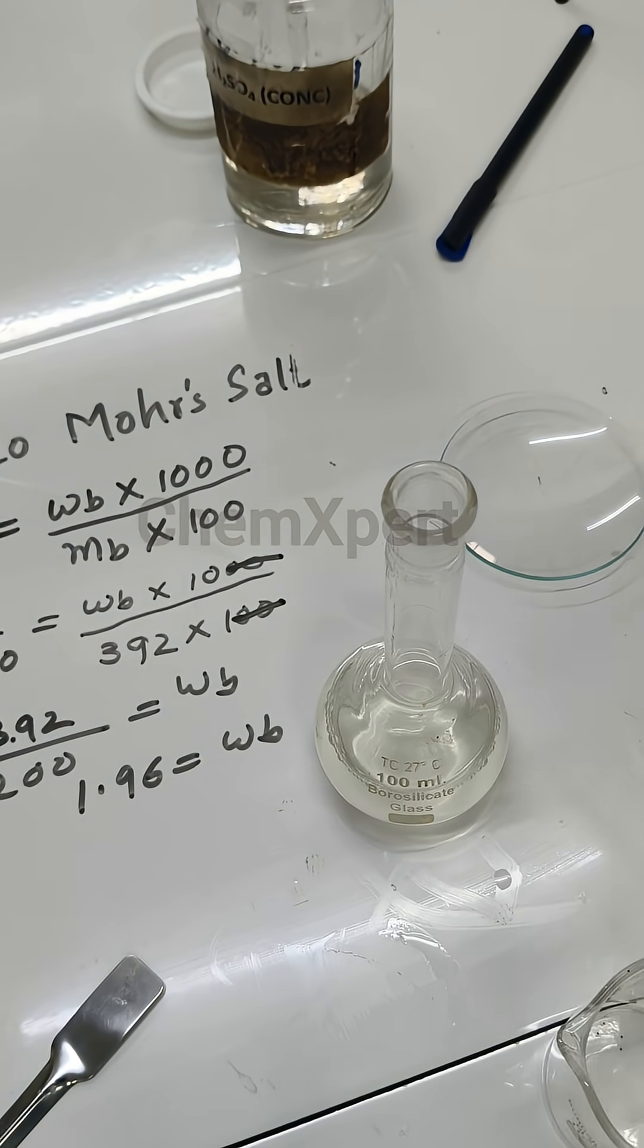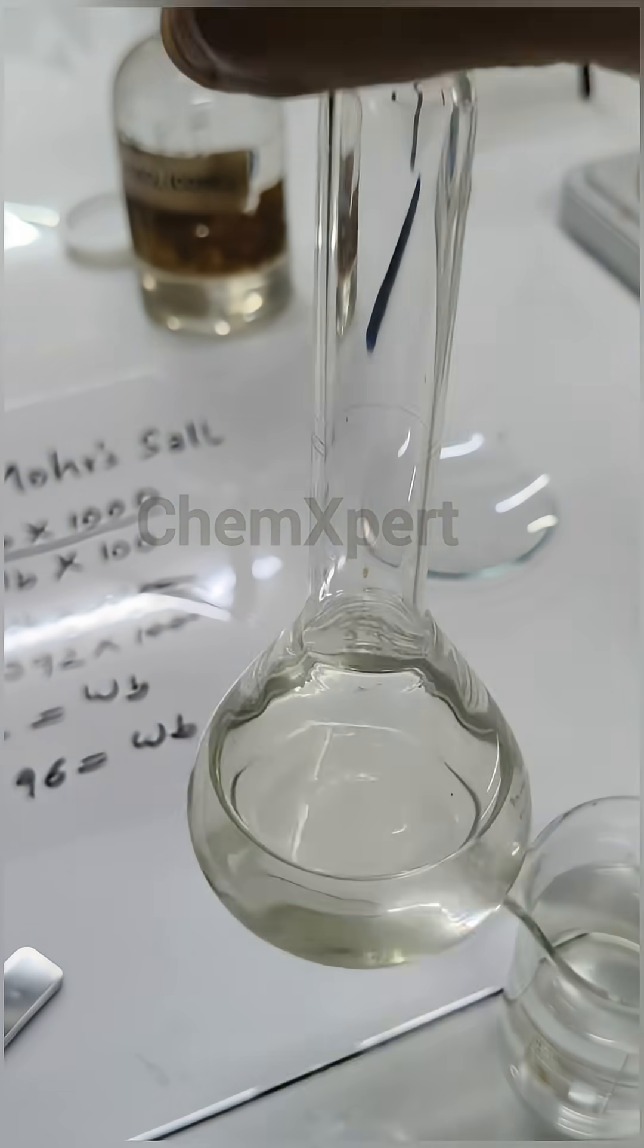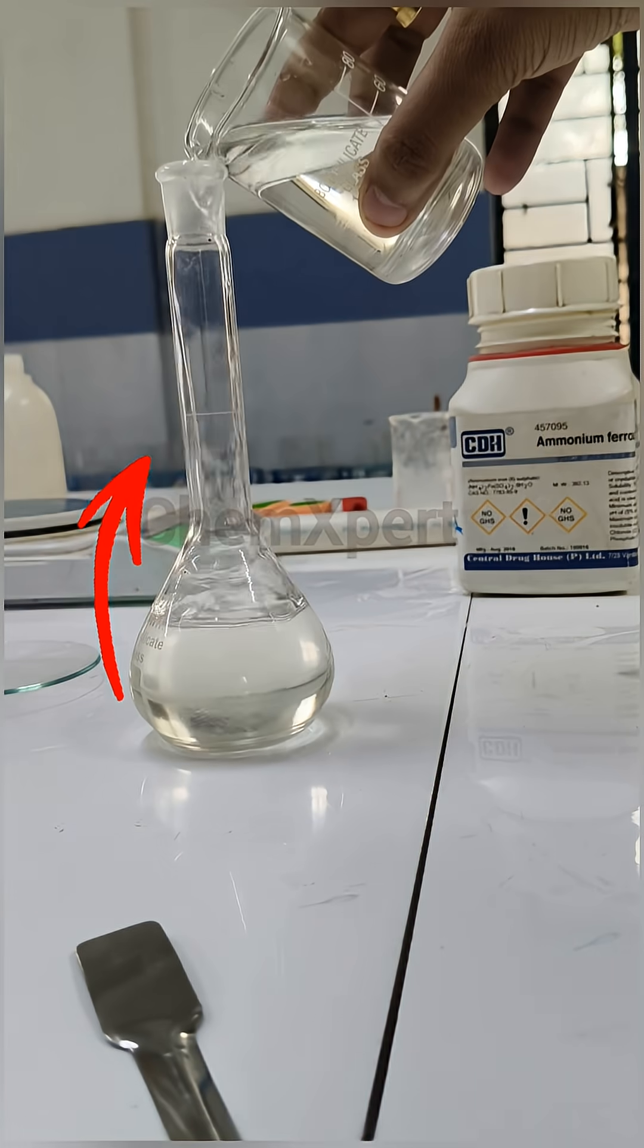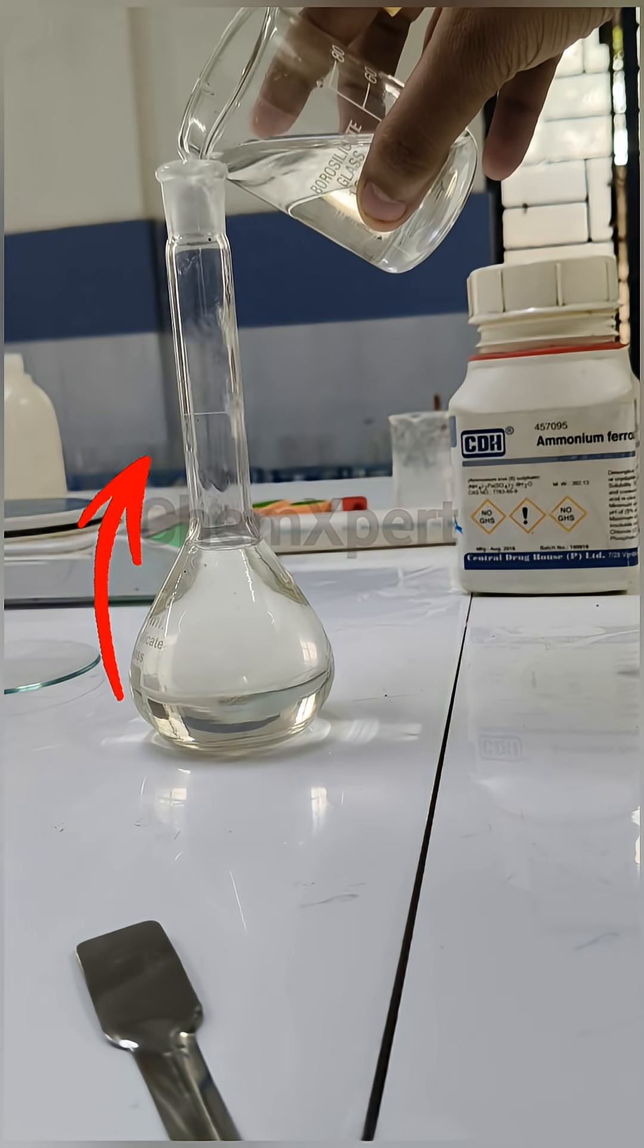Then we have to fill this standard flask up to a mark which you can observe here. You can observe there is a mark on this standard flask. We have to fill this flask till that point.